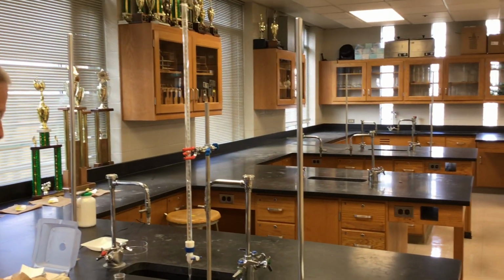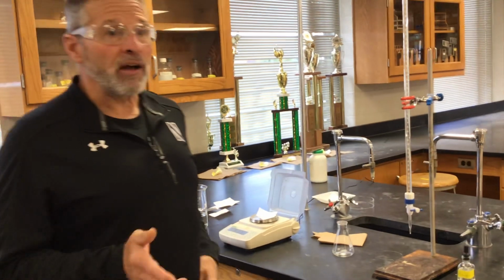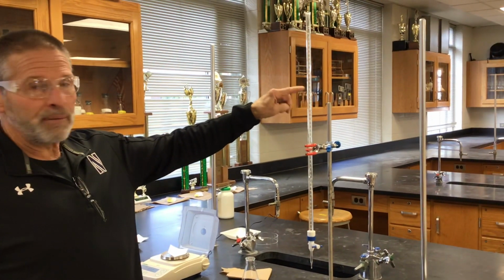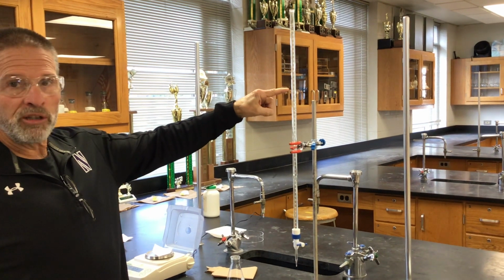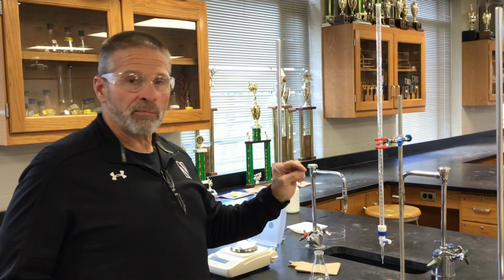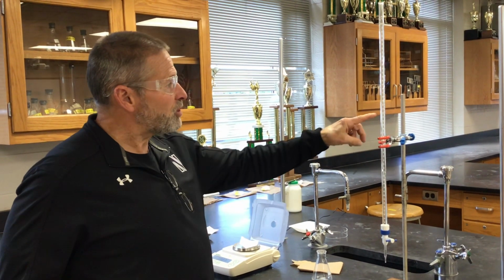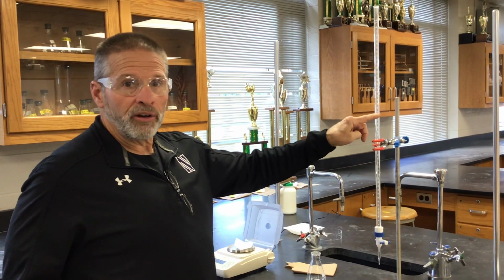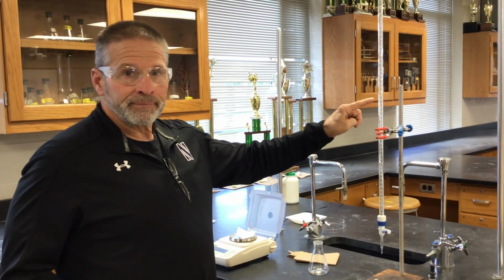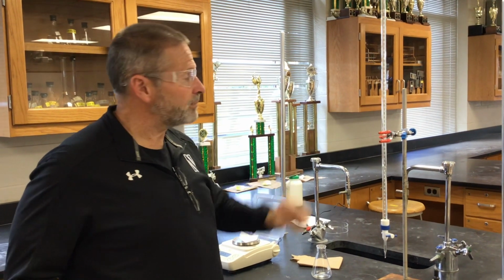Okay, so now the next thing is this. This lab involves a titration using some sodium hydroxide base that's going to be in the burette, and we're going to titrate then some unknown acid samples. But we can only make this useful if we know the molarity of the base that is in this burette, because I want to be able to go molarity times volume in liters to get moles.